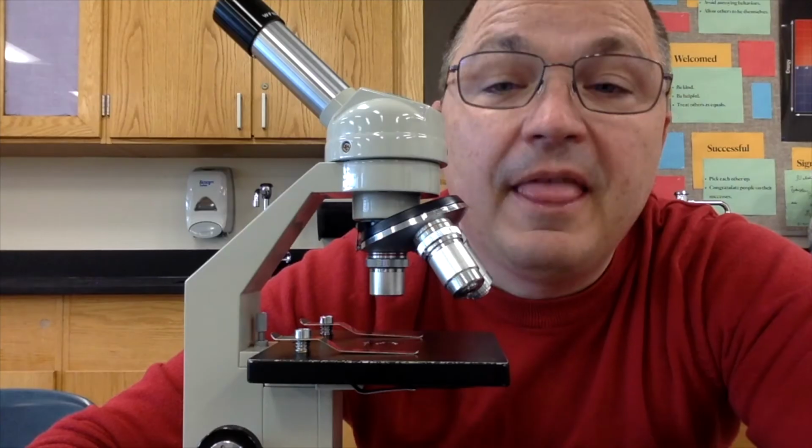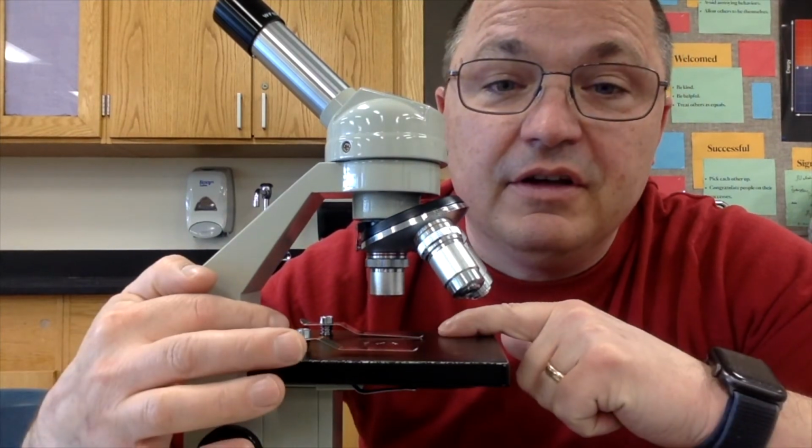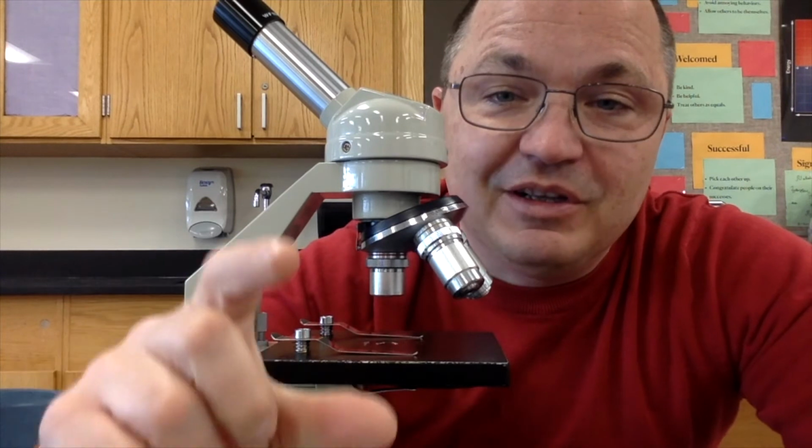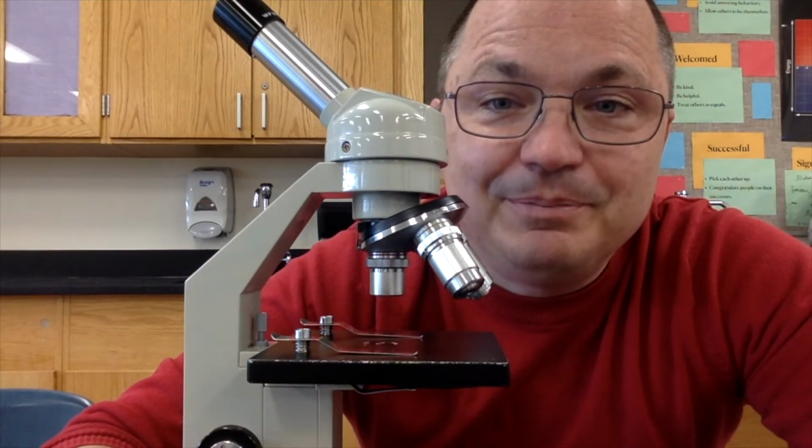It's important that the magnification you use in your image matches the magnification that I used when I took my images. You will be assessed on the quality of your image, having correctly identified the substance, and having correctly identified the magnification I used. Finally, when you're all finished, make sure that you leave the microscope clean off the slide glass and the cover slip, and leave them back the way you found them.